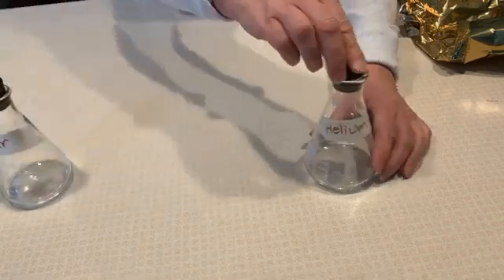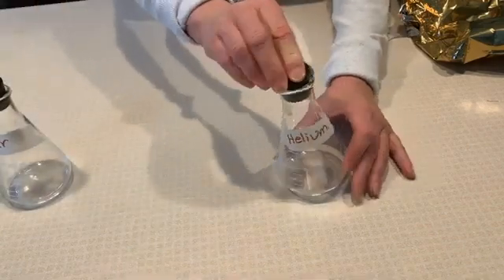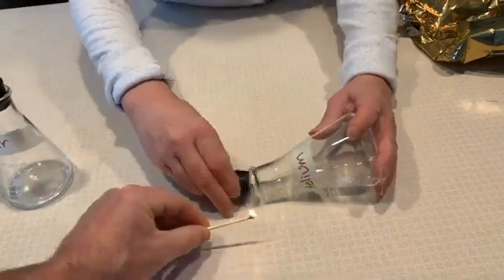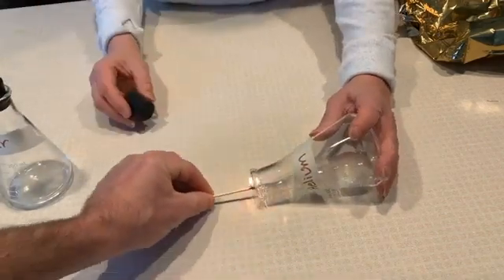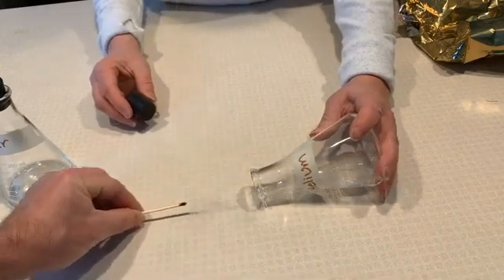And then we'll test the flammability of helium. They repeat the process with the helium flask. The match is inserted and immediately goes out.